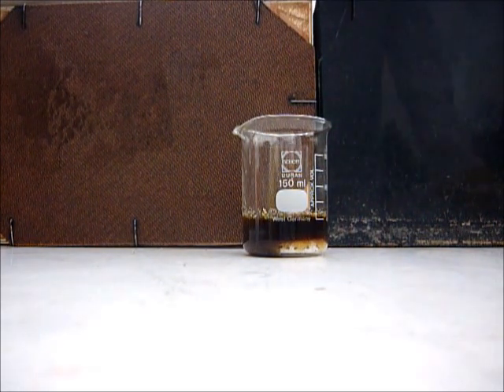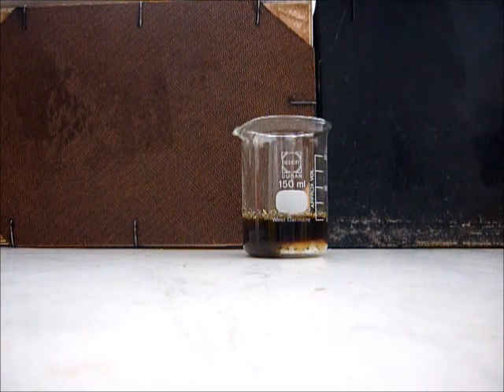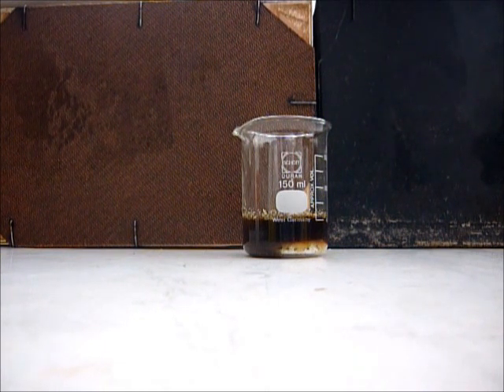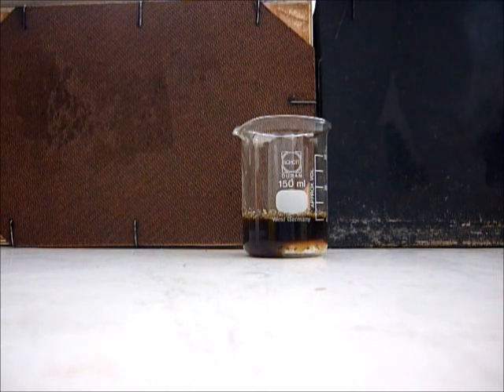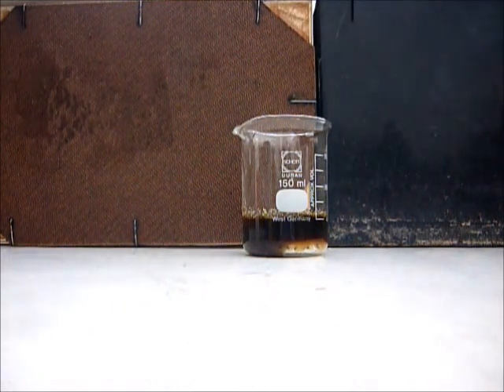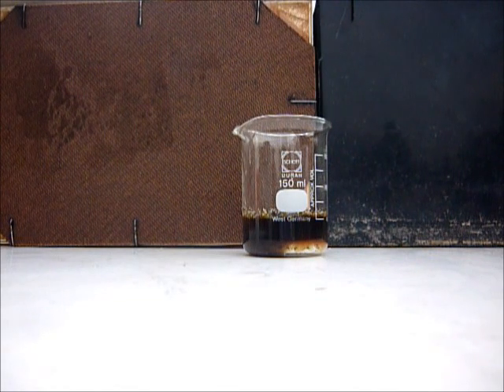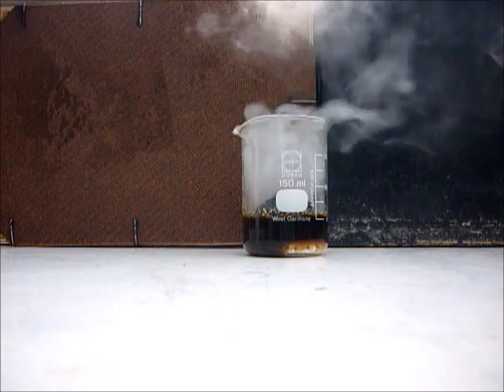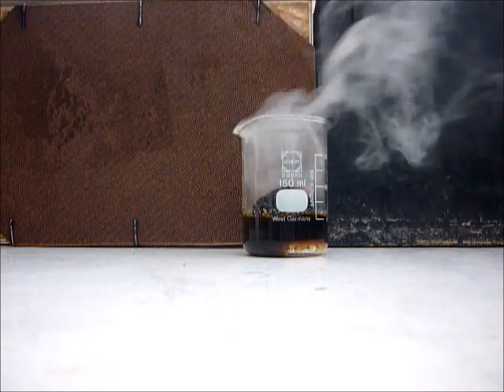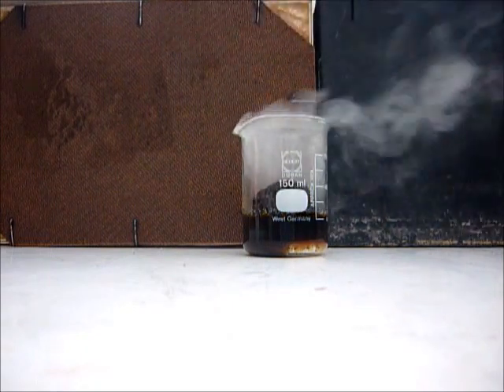After a few minutes it will start to get really hot so that the water evaporates, and this is happening now. You see it's fuming. The whole thing is building a big column of carbon.